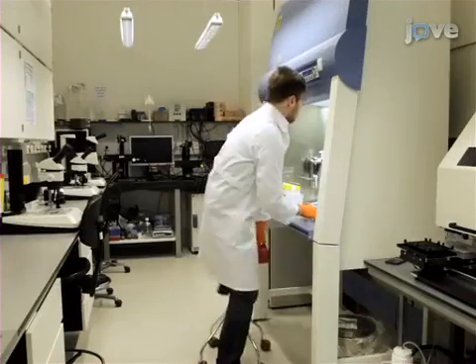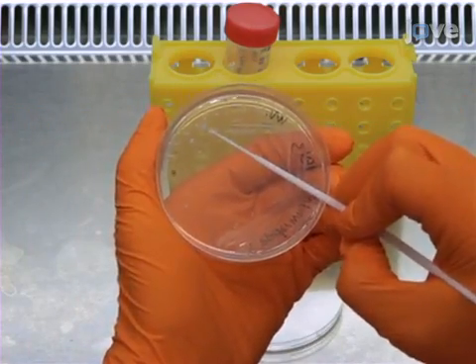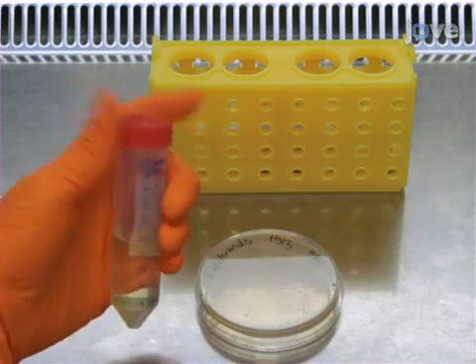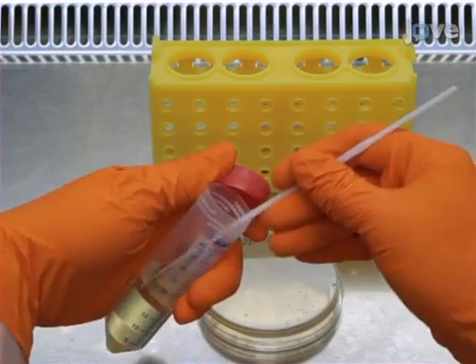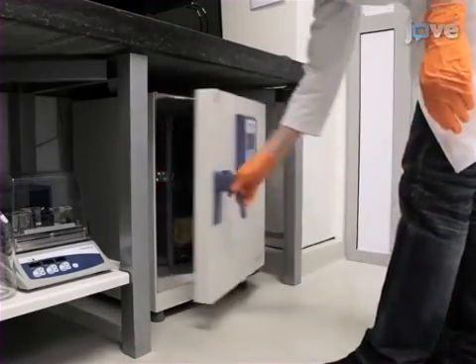To prepare S. epidermidis inoculum, isolate several individual colonies from a plate of S. epidermidis strain 047 containing a pWVW189-derived mCherry expression vector and inoculate 25 milliliters of LB supplemented with 10 micrograms per milliliter chloramphenicol. Incubate overnight at 37 degrees Celsius to mid-log stage.